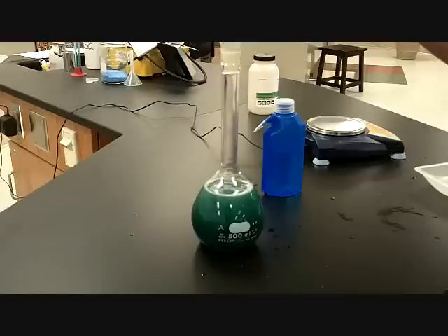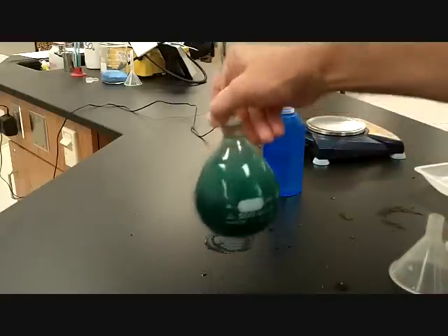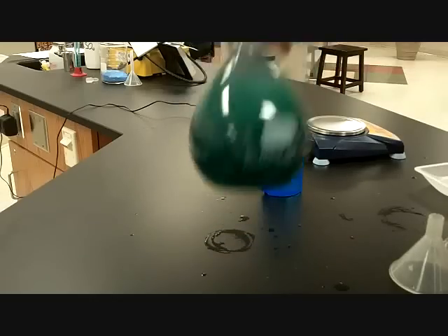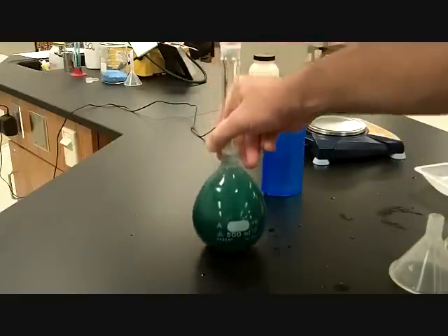There you go. There you go. All right, slow it down a little, slow it down. Okay, so we are really close, okay? Yeah, go ahead and add the rest of that. Okay, so there's enough. All right, now here's what I want you to do. Actually, let me give a little shake here. Kind of mix it up a little more. Okay, since we're real close to that line, I want the bubbles to kind of go down a little bit.